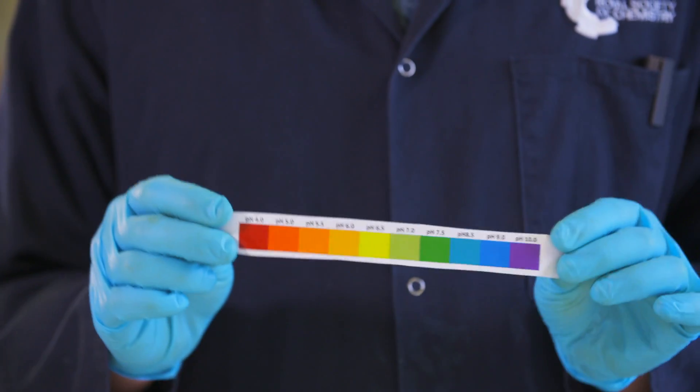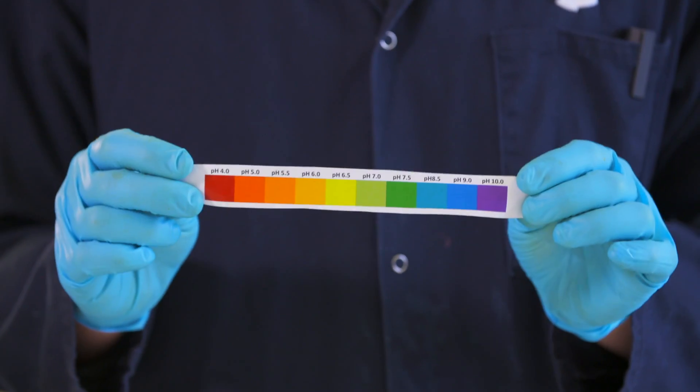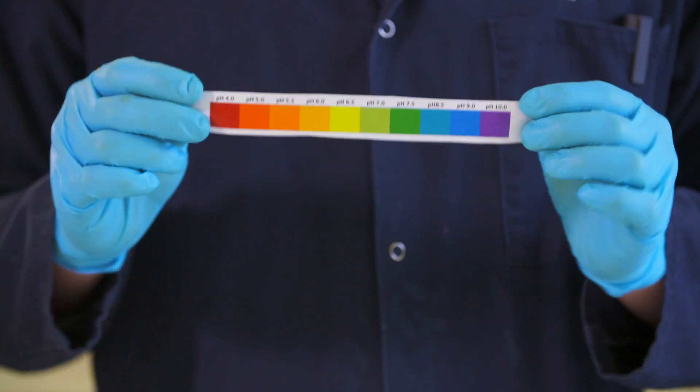Measuring the rate of reaction in this way is quite simple because we can measure the volume of gas that's produced. But what about a reaction where a colour change happens? We can use a colour scale such as with pH changes and an indicator, or we could use a colourimeter. Matching the colour change onto the chart can be quite difficult because the changes are so gradual.